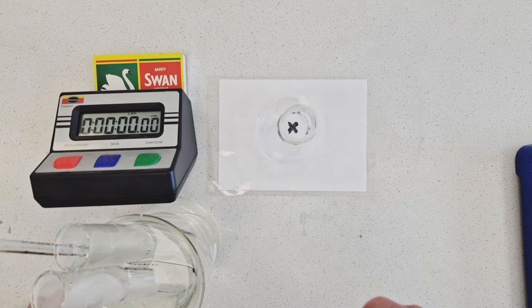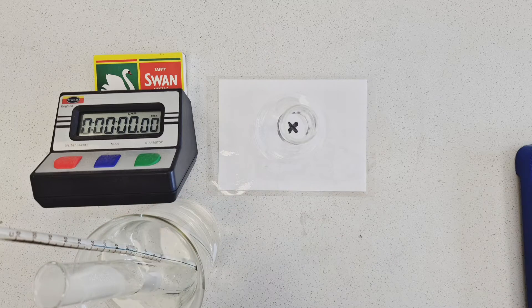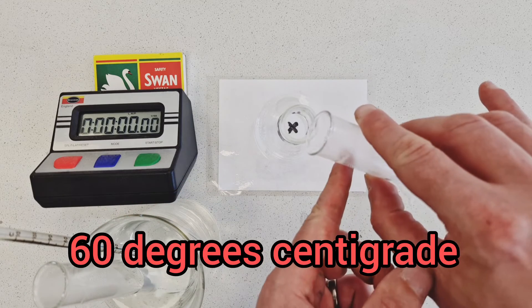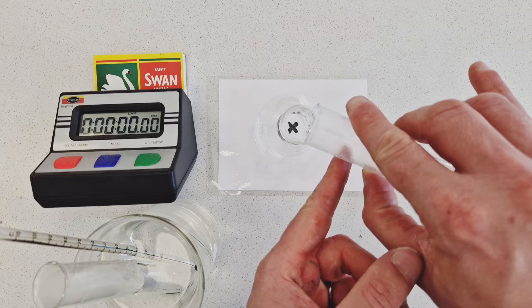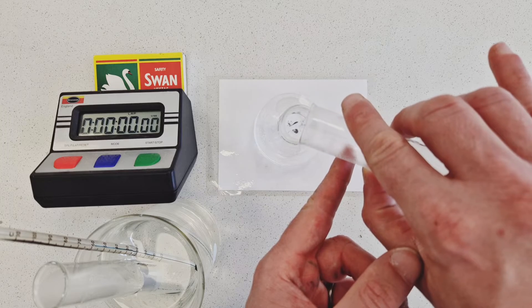Compared to, say, a high temperature experiment like this one where I've raised the temperature of the reactants to 60 degrees centigrade. Let's watch the difference in terms of the speed of the reaction.